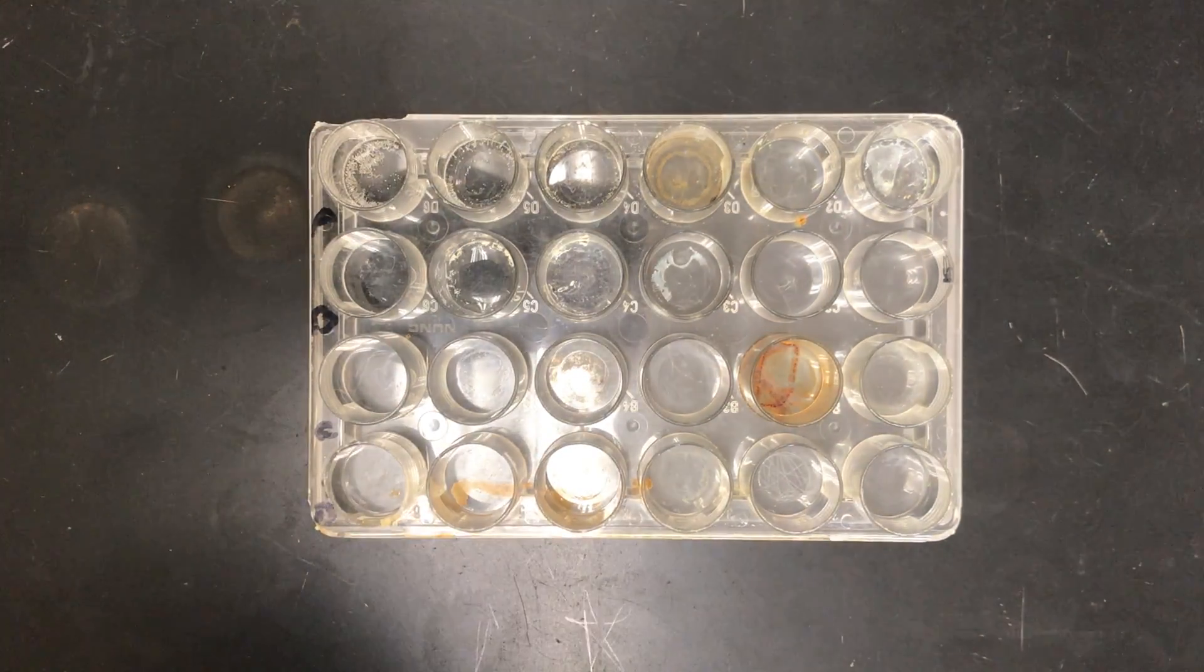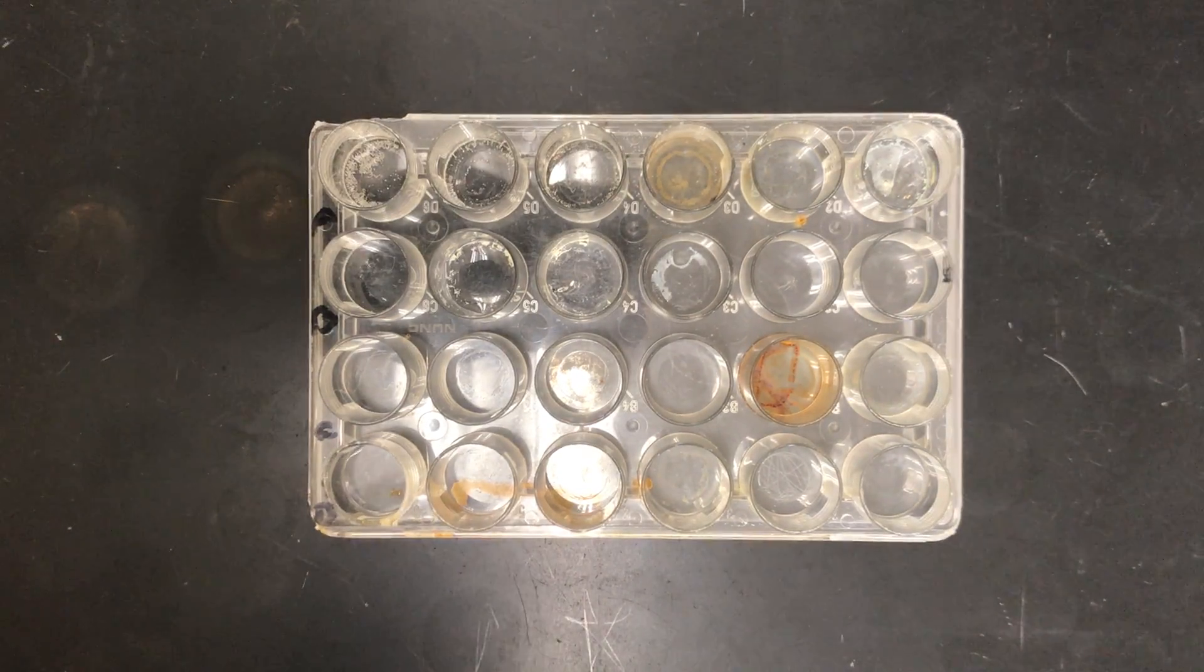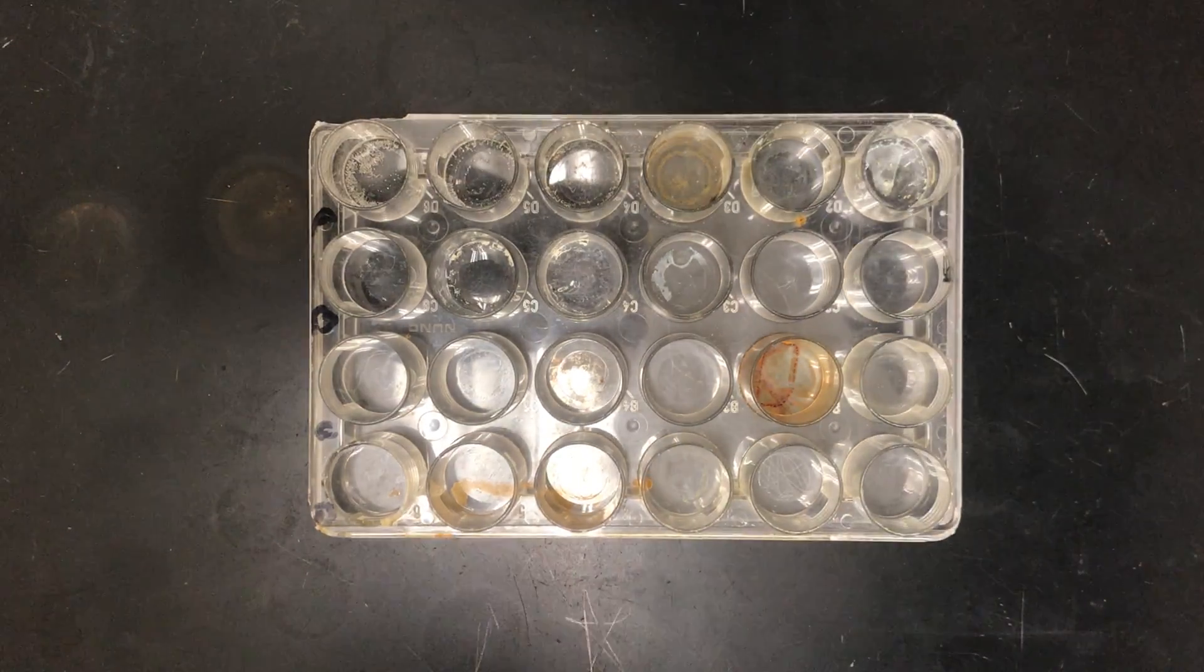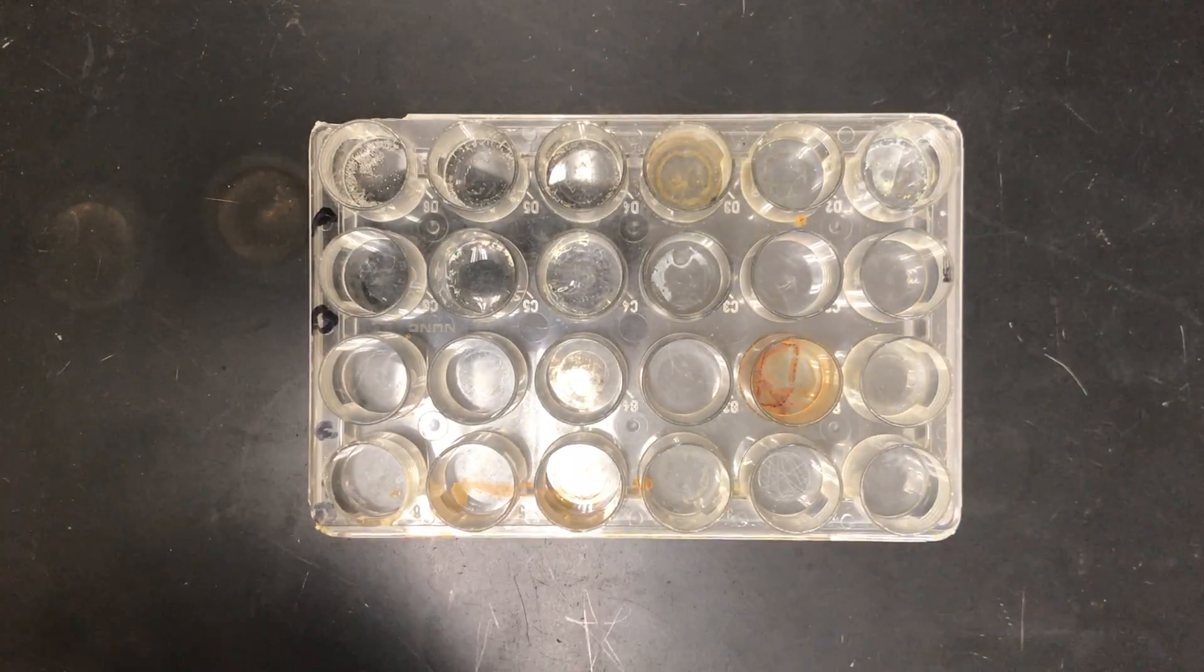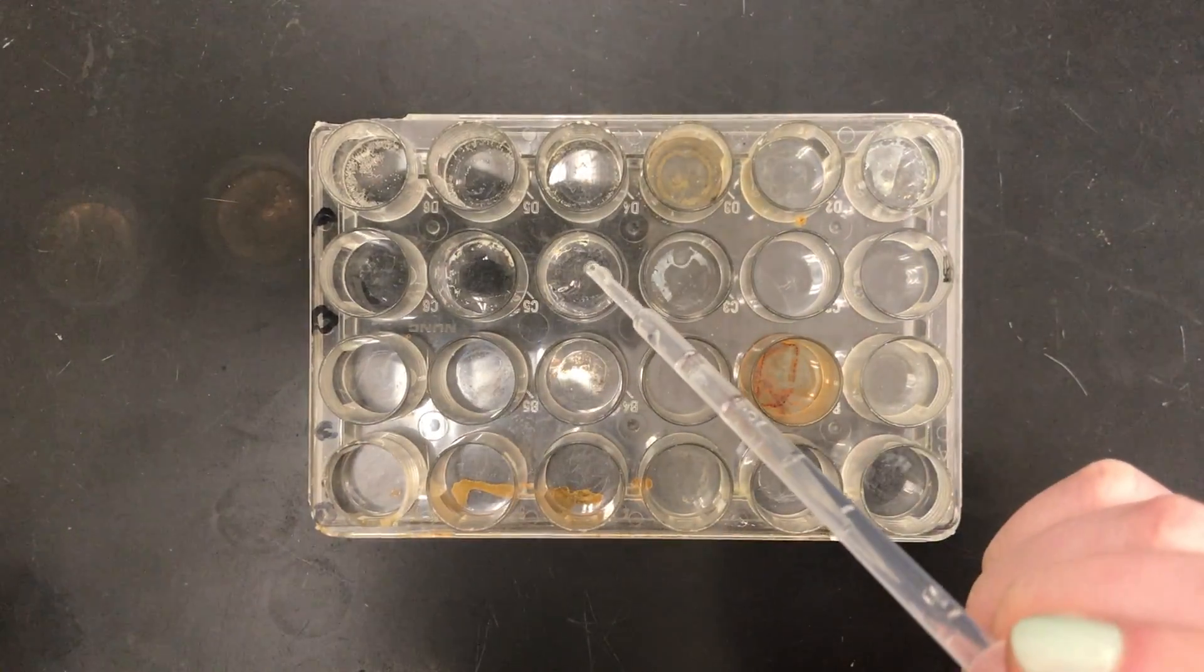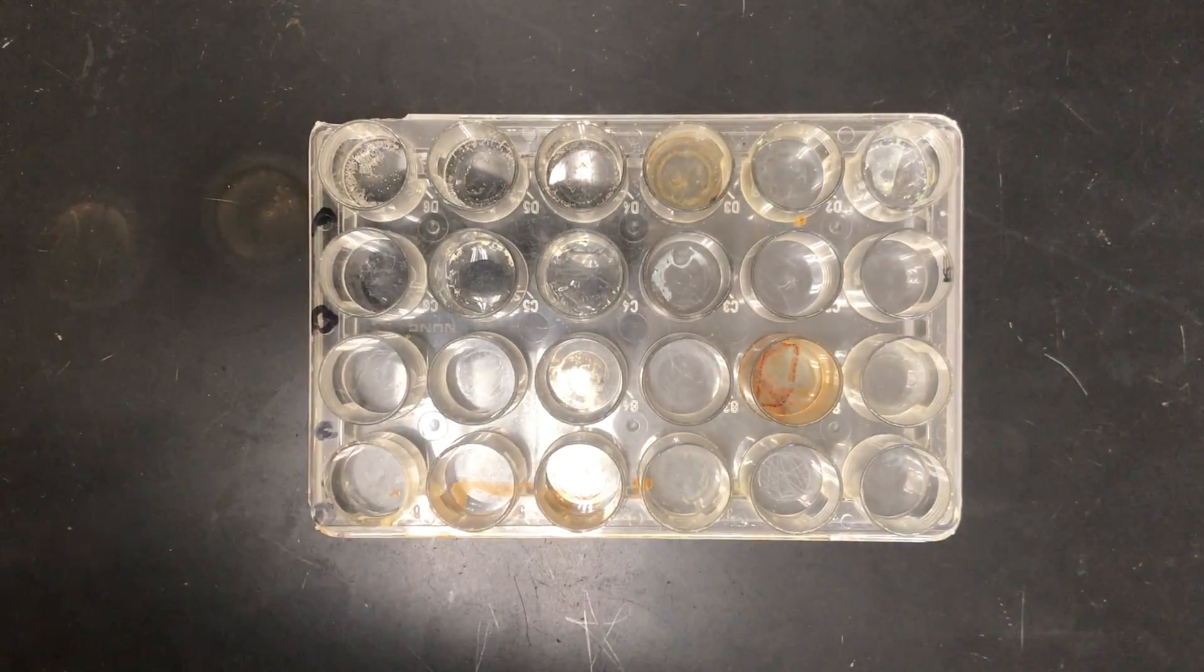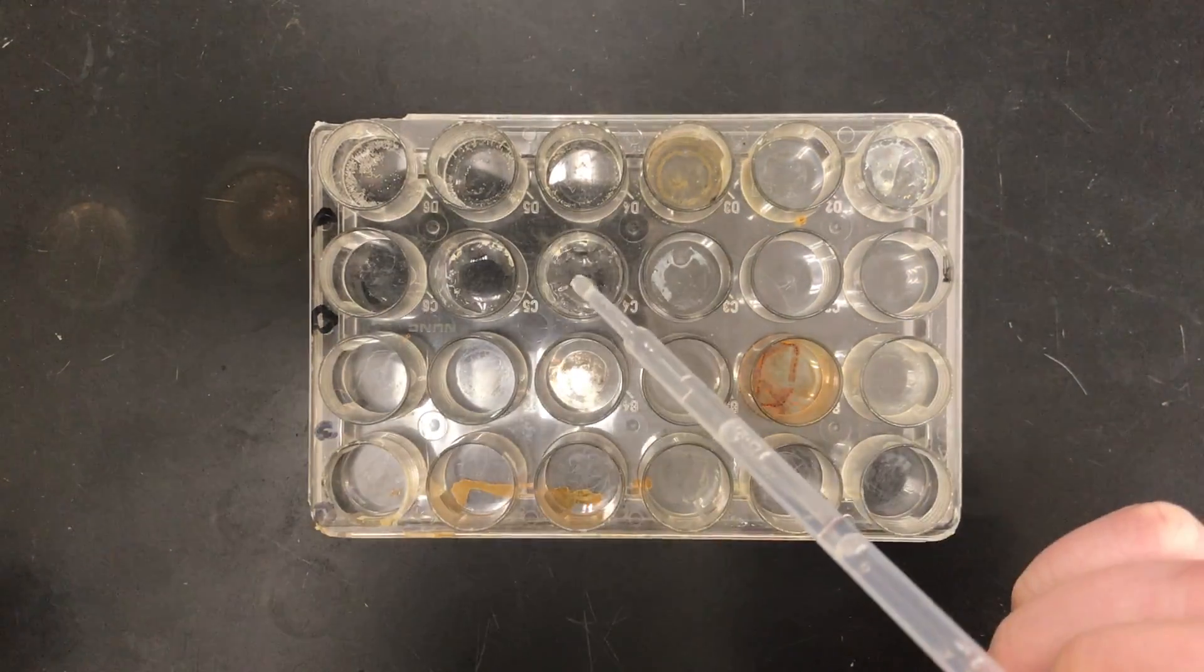Make your observations there, and then we're going to go potassium iodide and sodium carbonate. So here we go, potassium iodide and sodium carbonate.